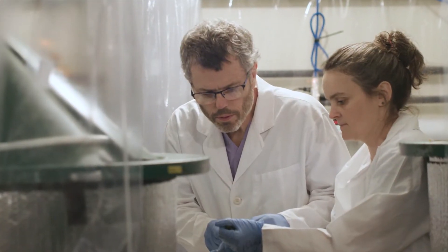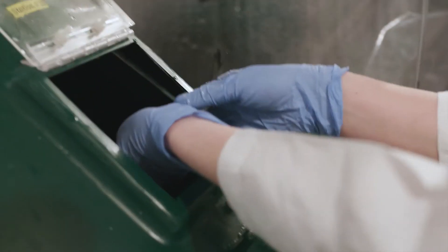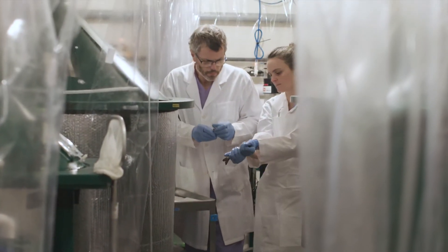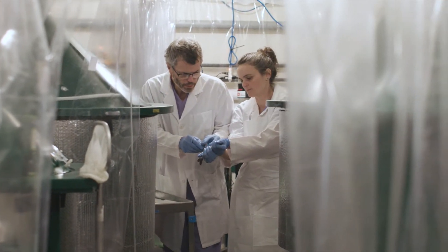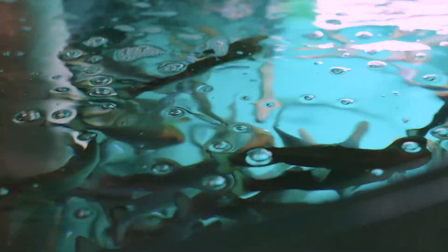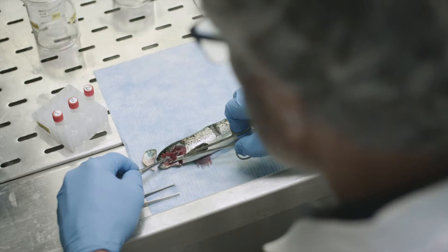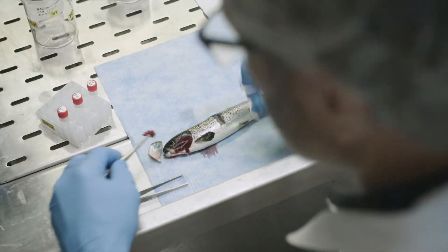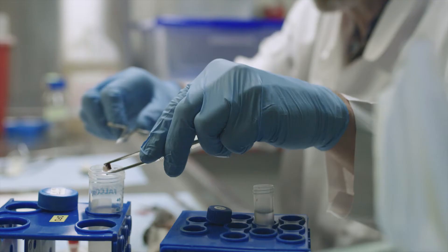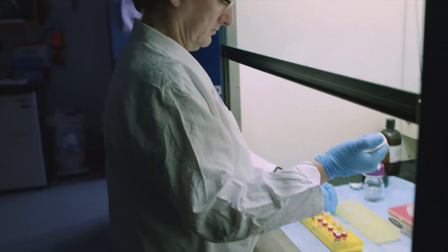Over the course of the next 8 to 12 weeks we're going to measure shedding rates — the amount of virus given off by these populations of infected salmon into the water. Once the animals are infected, we will collect them at certain intervals and then we'll do a necropsy.